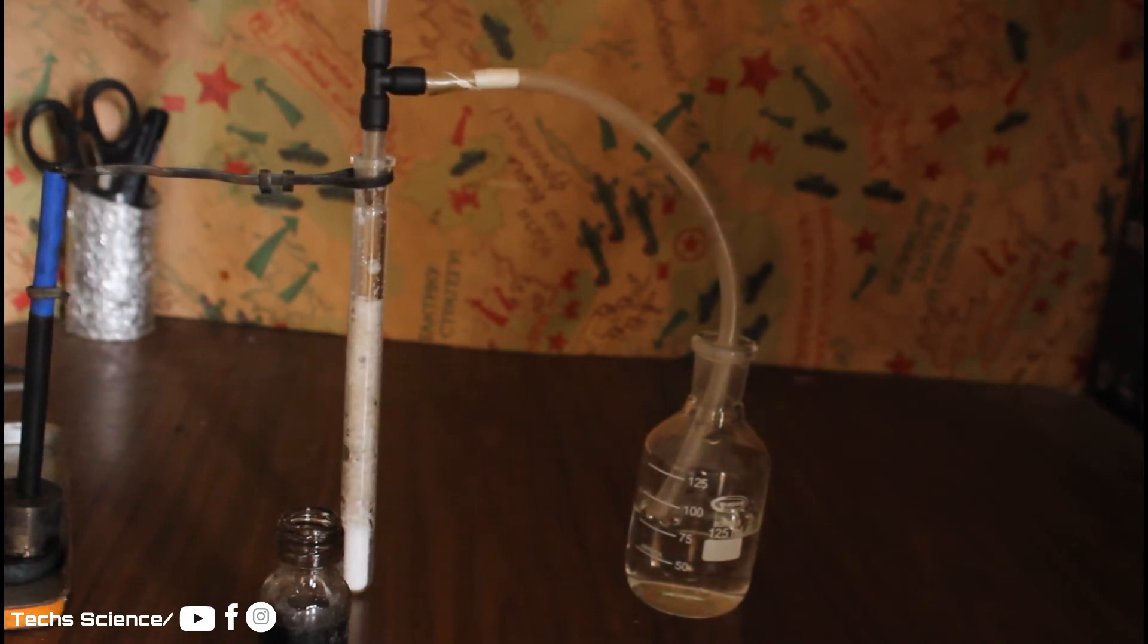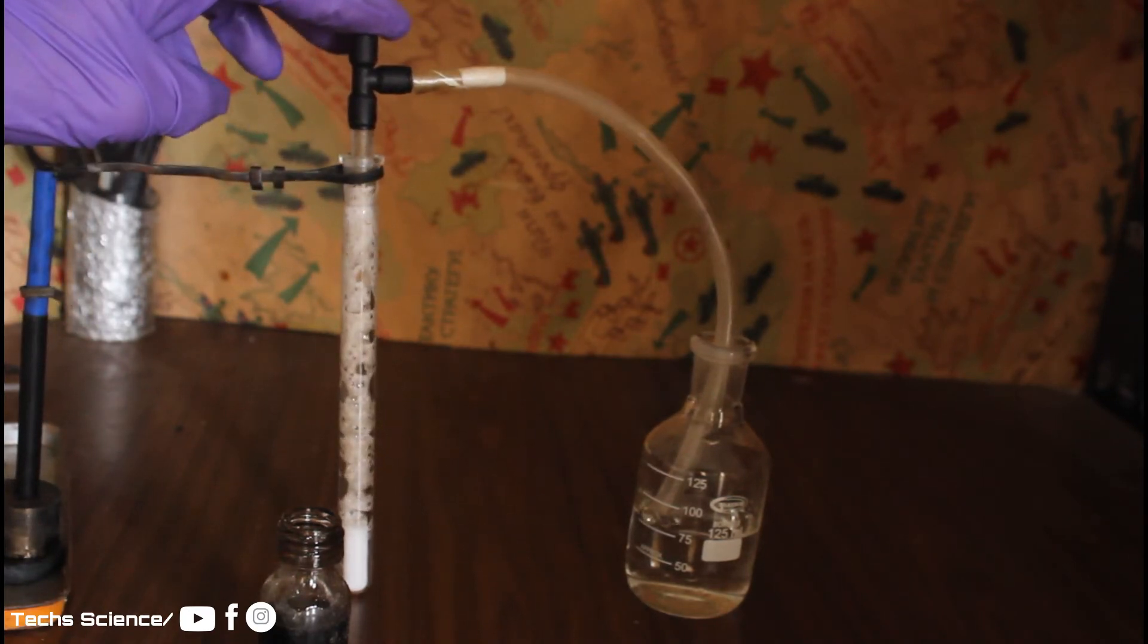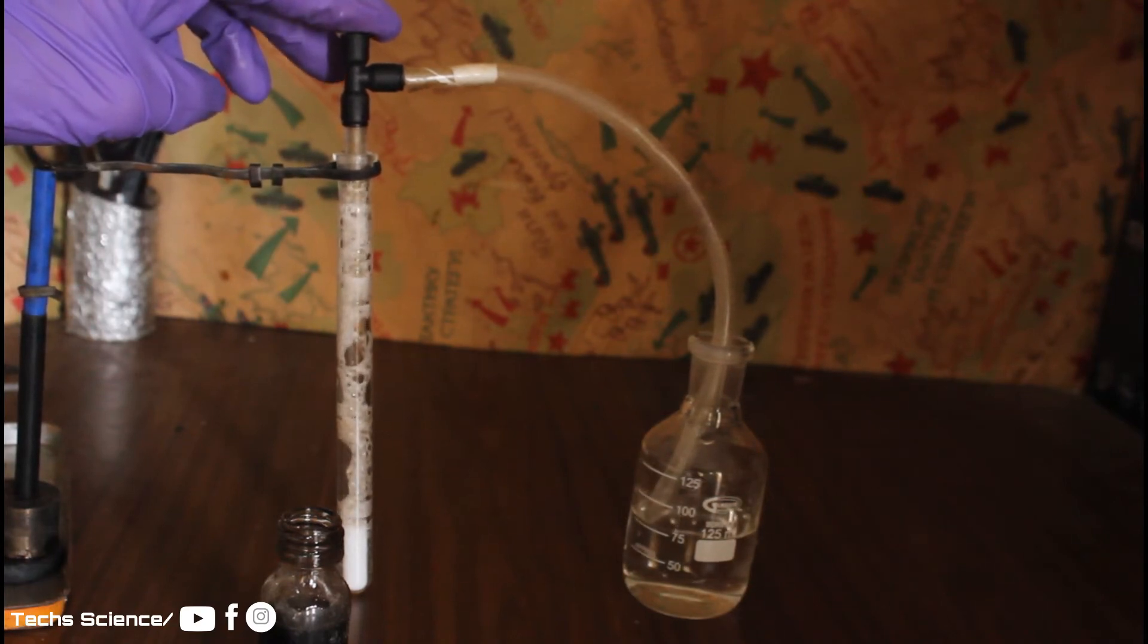You can see the bubbles rising. It's HCl gas. I should put my finger to avoid the gas leakage.